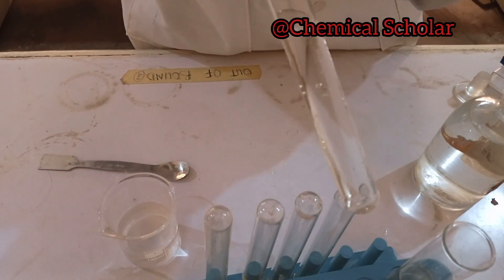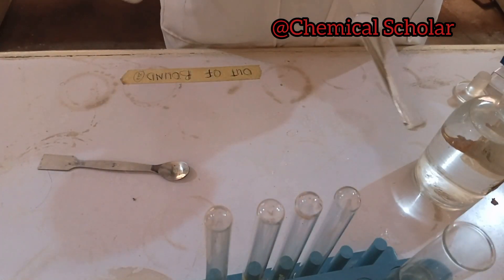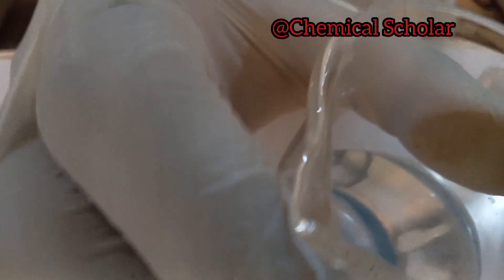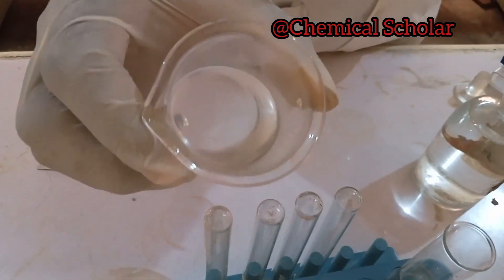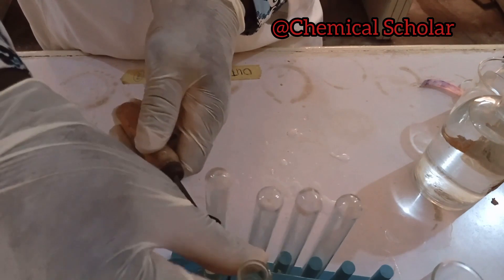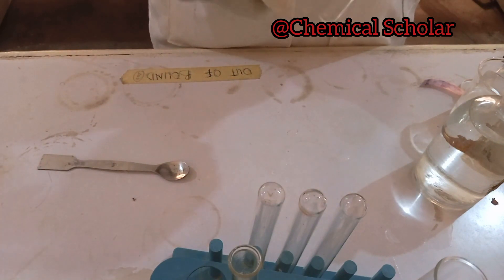You can see how the gas has changed the litmus paper. The gas is still coming out, so we bubble it into the lime water to see the reaction. You can see that a portion of the lime water has turned milky from the CO₂ gas. The gas is confirmed as carbon dioxide — CO₃²⁻ or HCO₃⁻ ion.